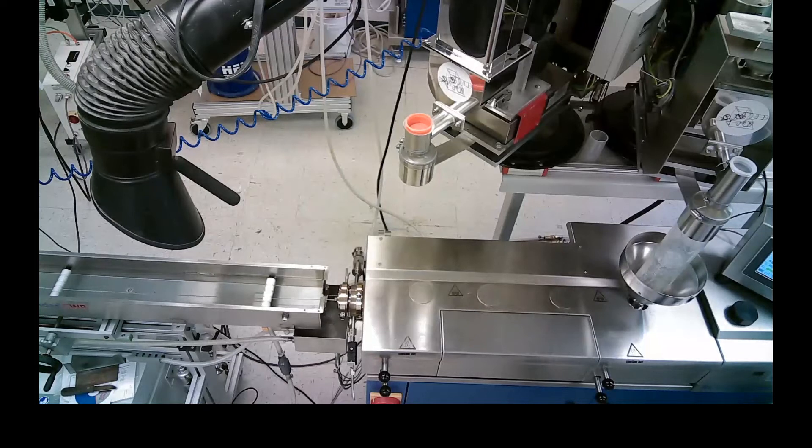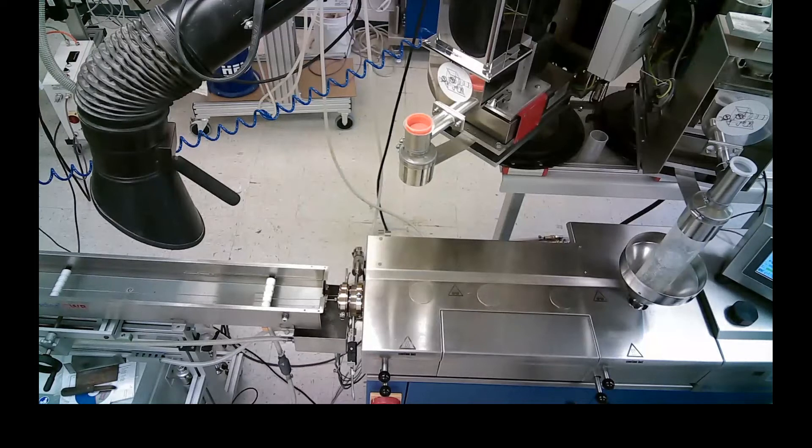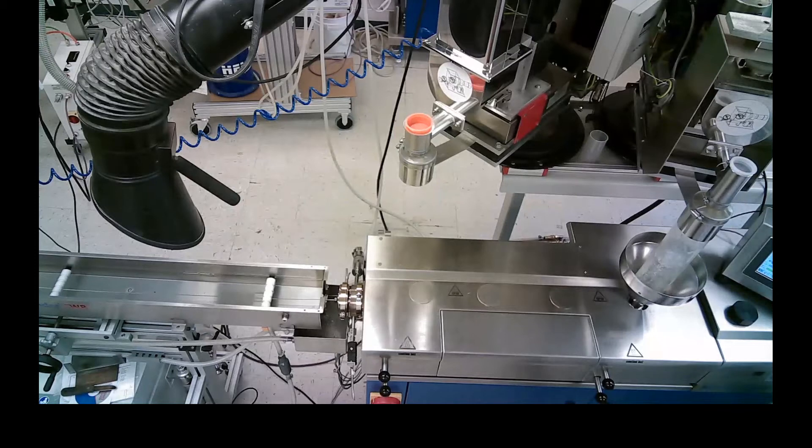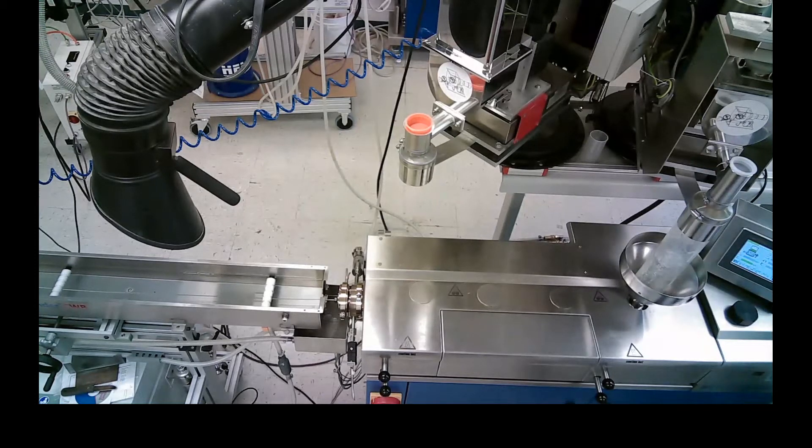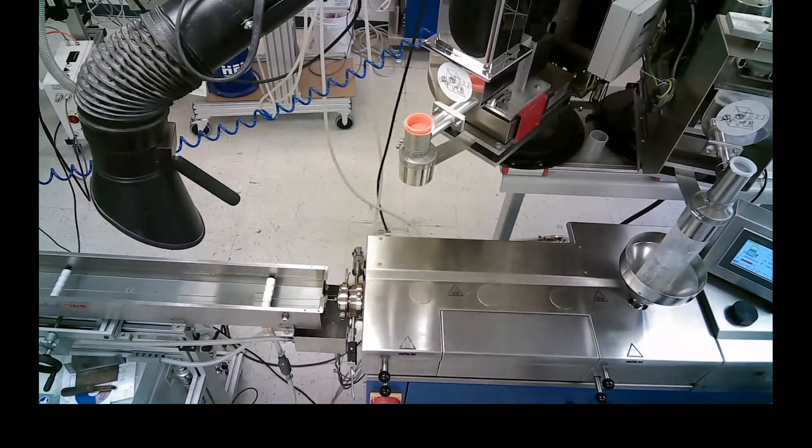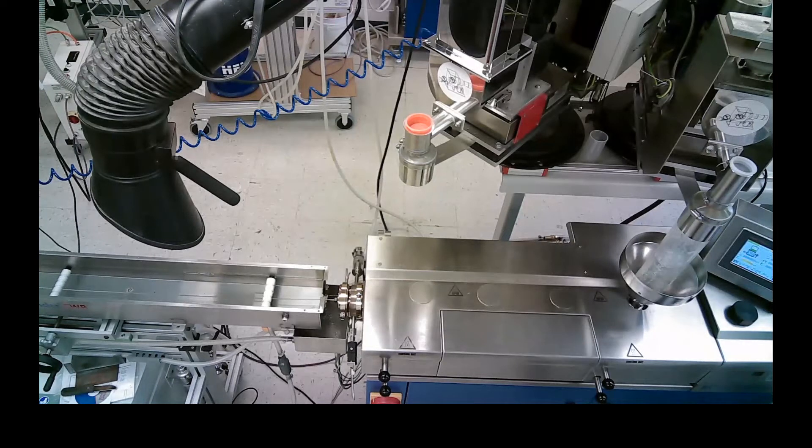We are currently running at a throughput of about three kilos per hour. The setup that we picked is a general purpose multiple intense mixing section screws.